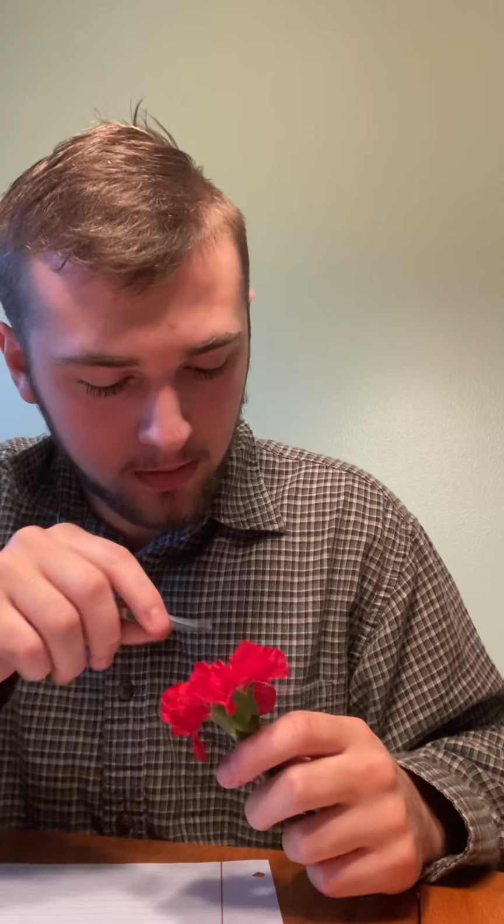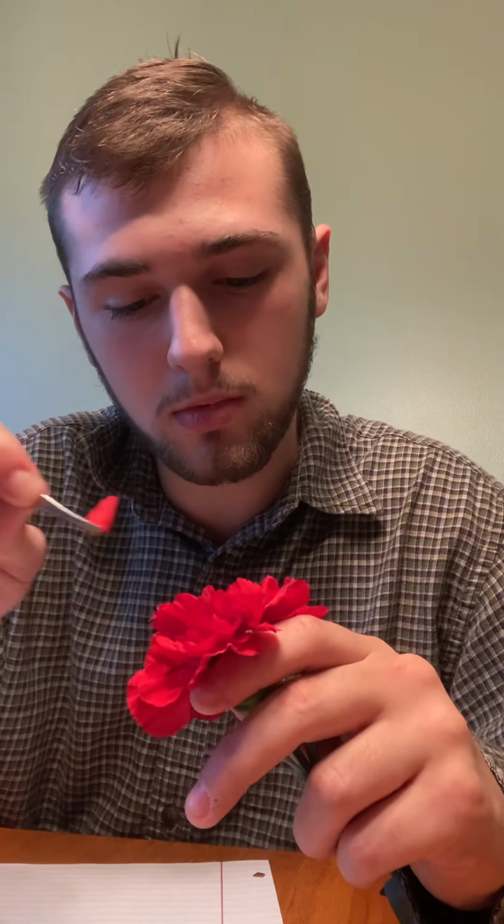Now to the stigma. I cannot really find it. This one's too well bloomed to really see it.